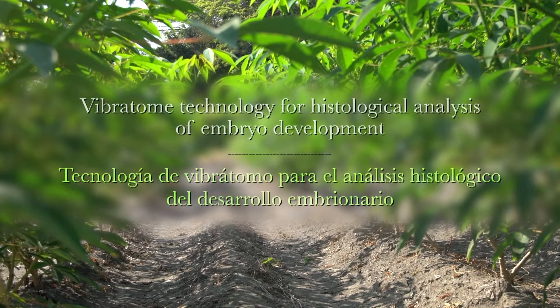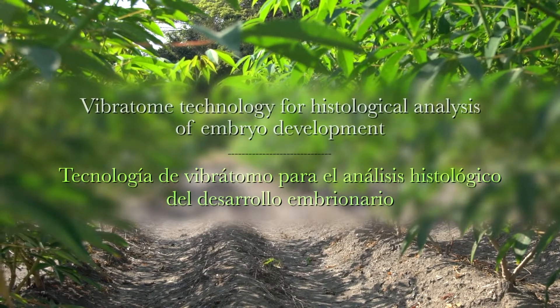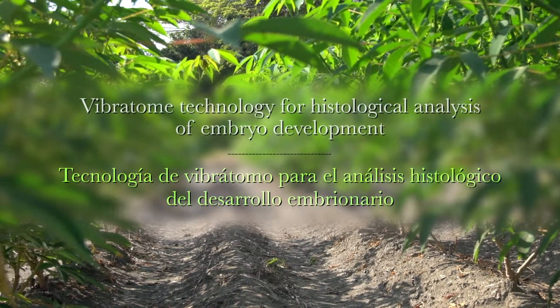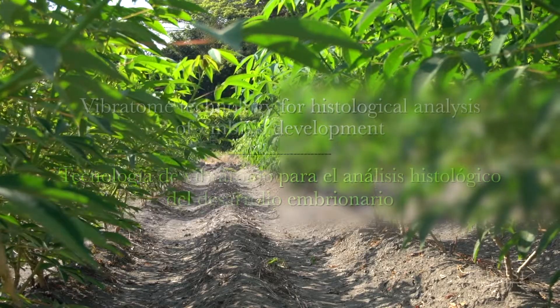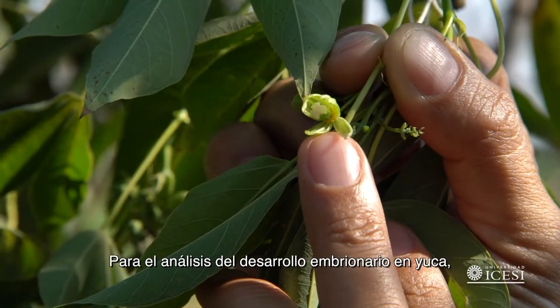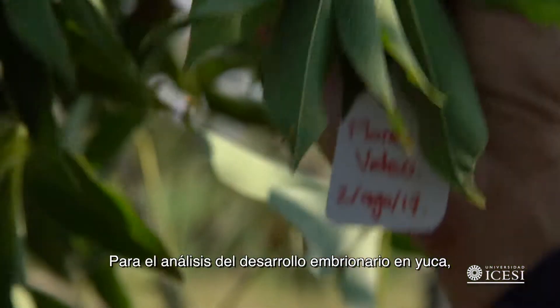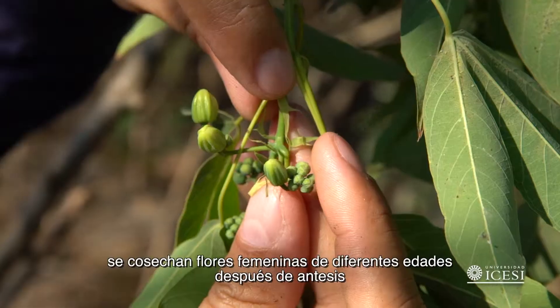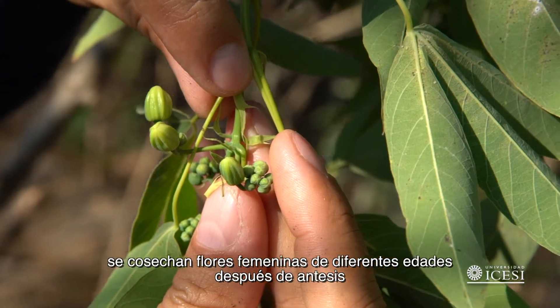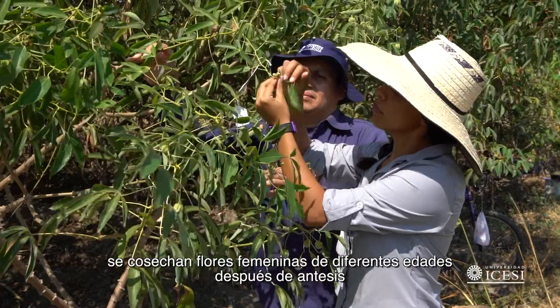Vibratome Technology for Histological Analysis of Embryo Development. For the analysis of embryo development in cassava, personnel will harvest female flowers of different ages after anthesis.